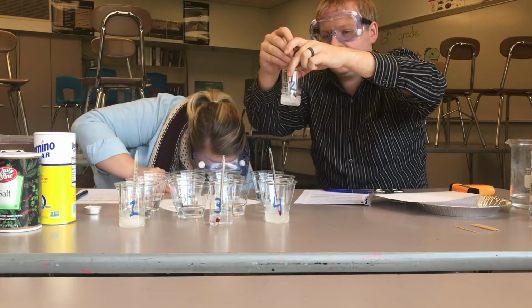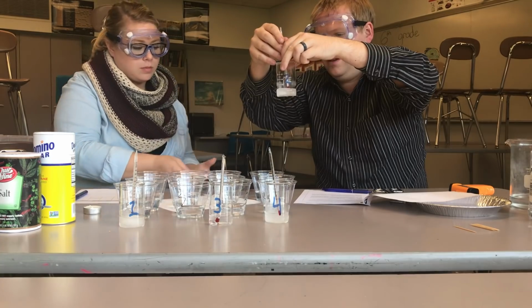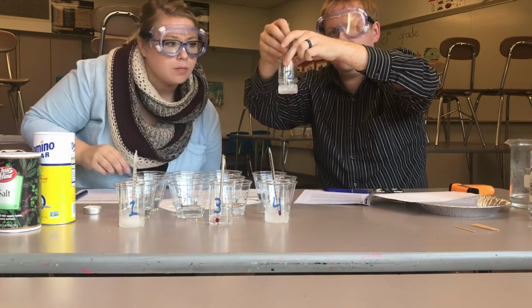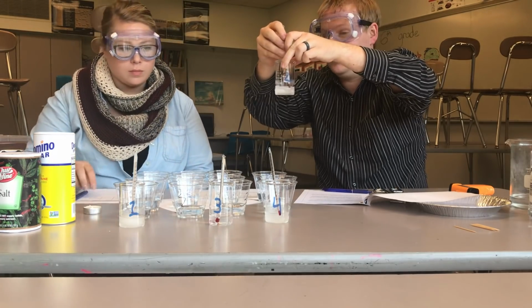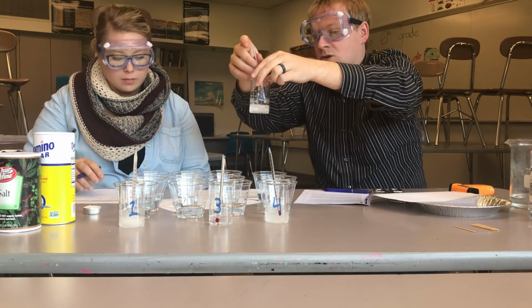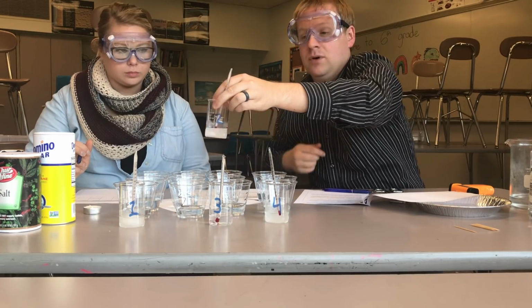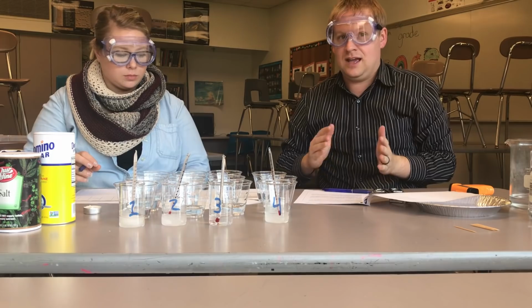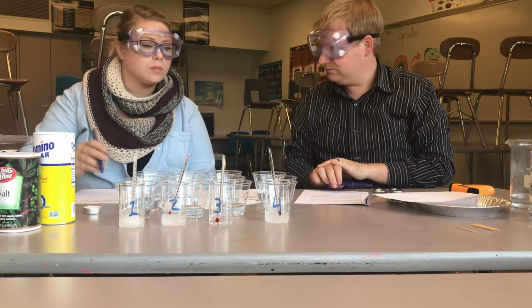Liquid 2, I think we're gonna have to come back to this one because it is still just above 0, and it's still a chunk, it's a solid. I don't know what liquid it is, but it's solid. So we're gonna come back to that one to try to look at its melting point, because melting point, we said, is where it goes from a solid and changes state into a liquid.